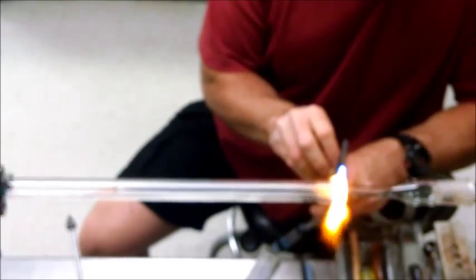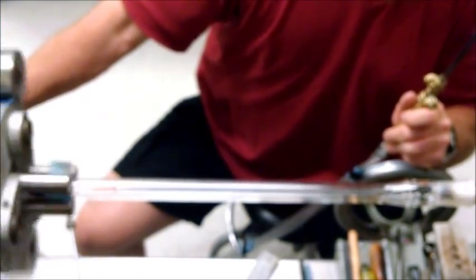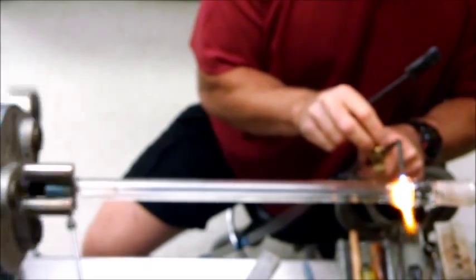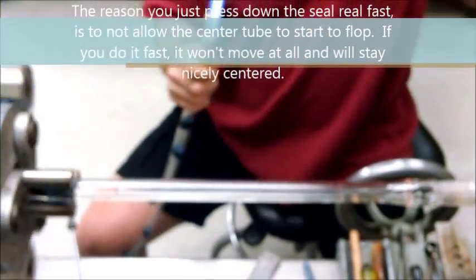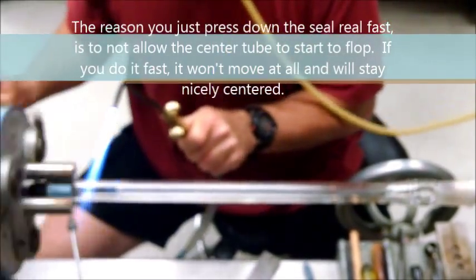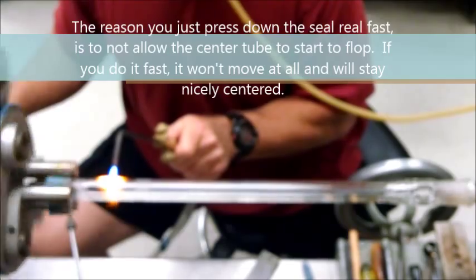So I get this color on it. Come over here, give it about where I want it, put it about there, preheat this up, and I'm just going to mash it down real quick. Make sure you make it seal. I like it to seal all the way around. While this is so hot, come over here — this has not moved at all. I'm supposed to do a ring seal on this.